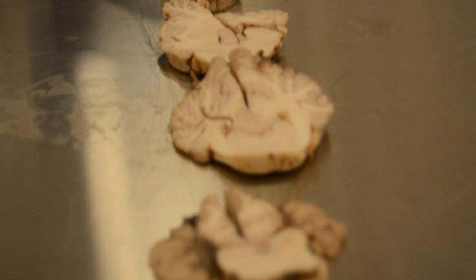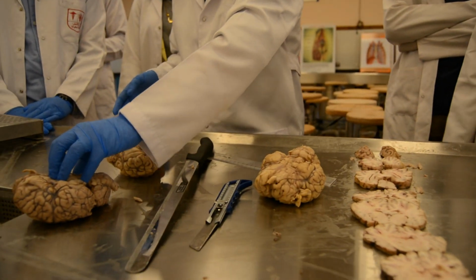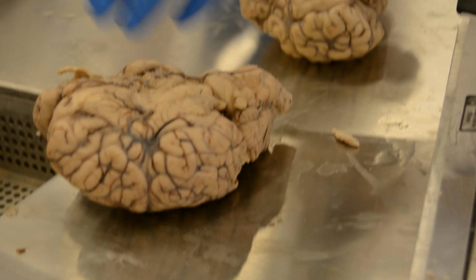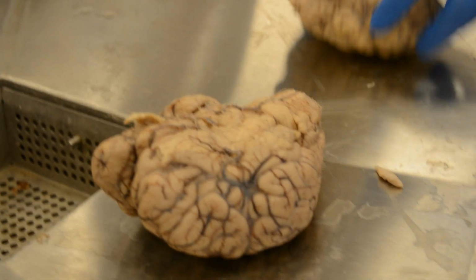Then the midbrain. These structures are very similar to the human brain, because the internal or central structures in a cow's brain are the areas supporting life, and only life and movement will be similar to a human, since we are all living. But the cerebral cortex of the higher function is less developed in a cow's brain.